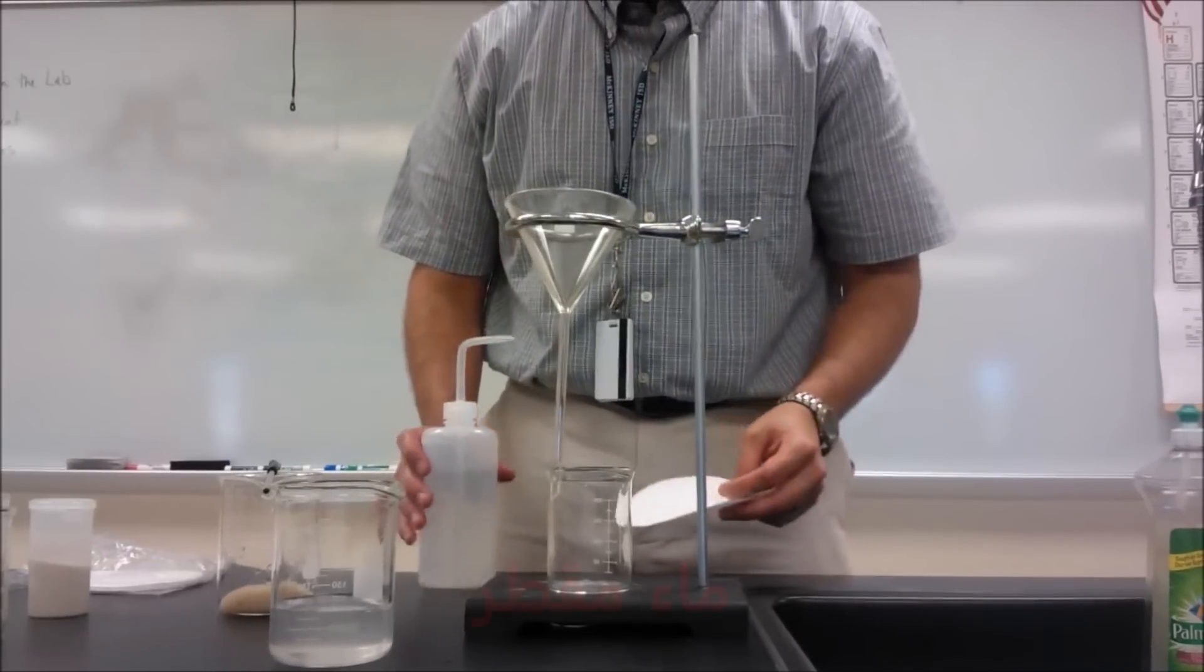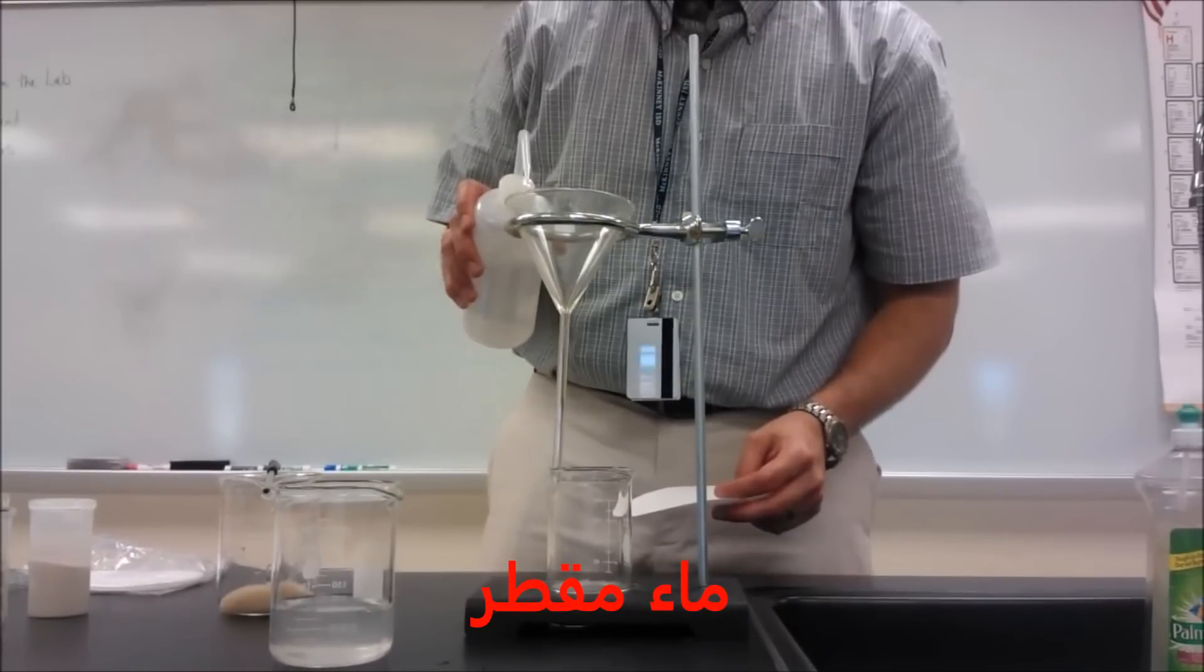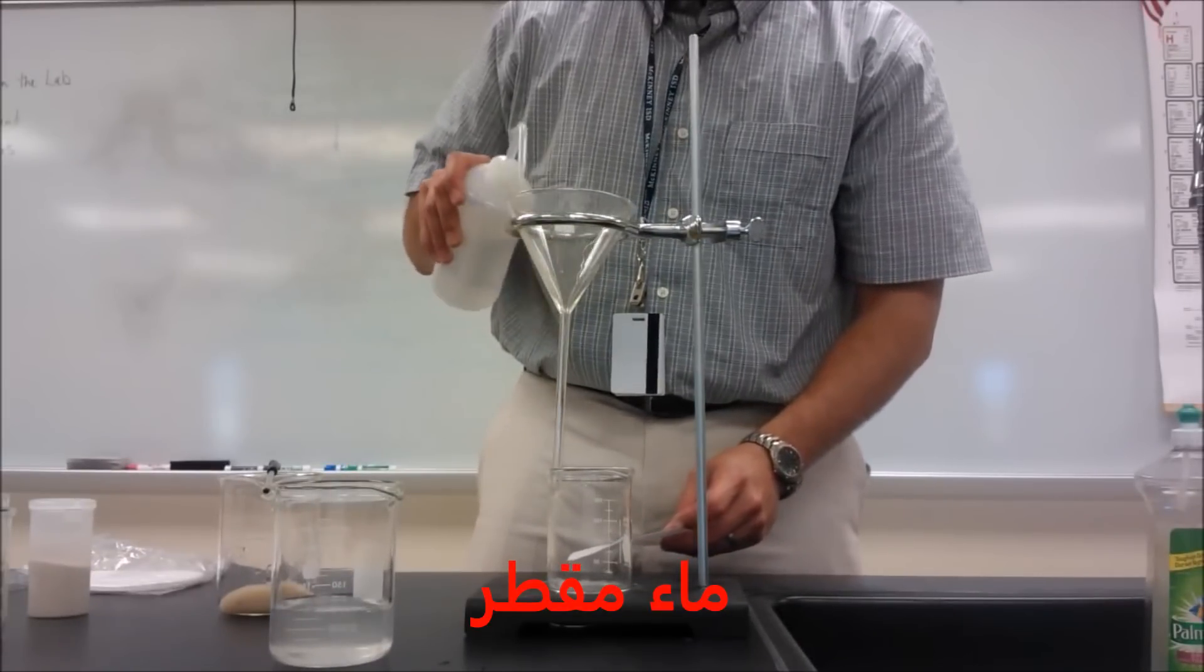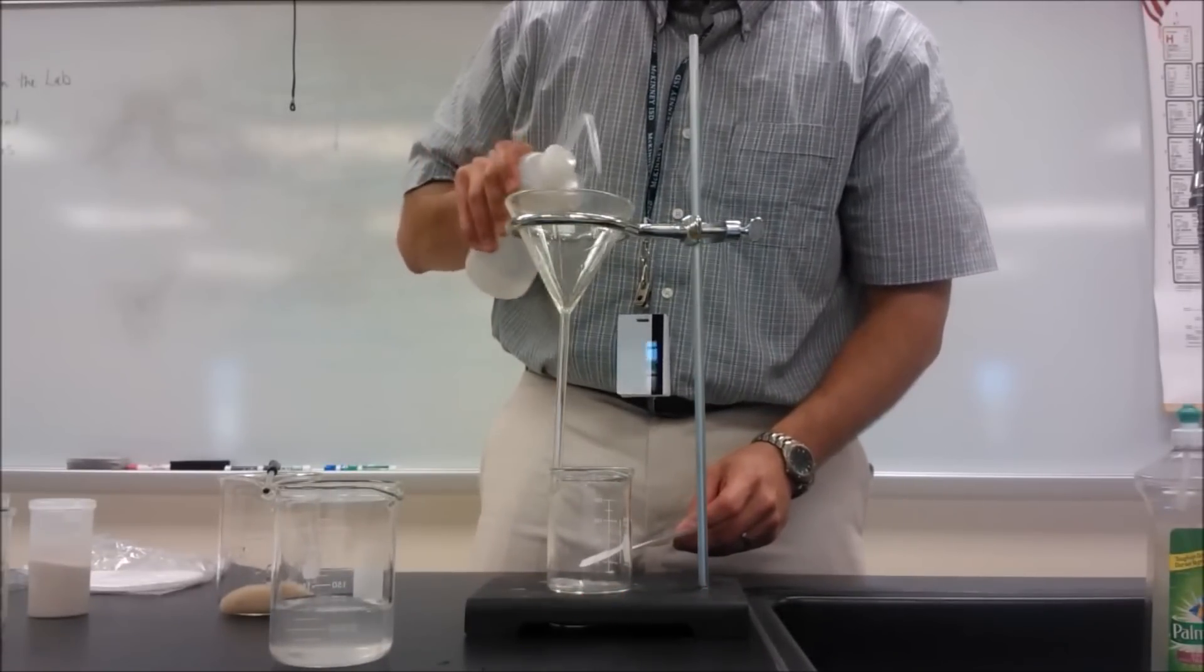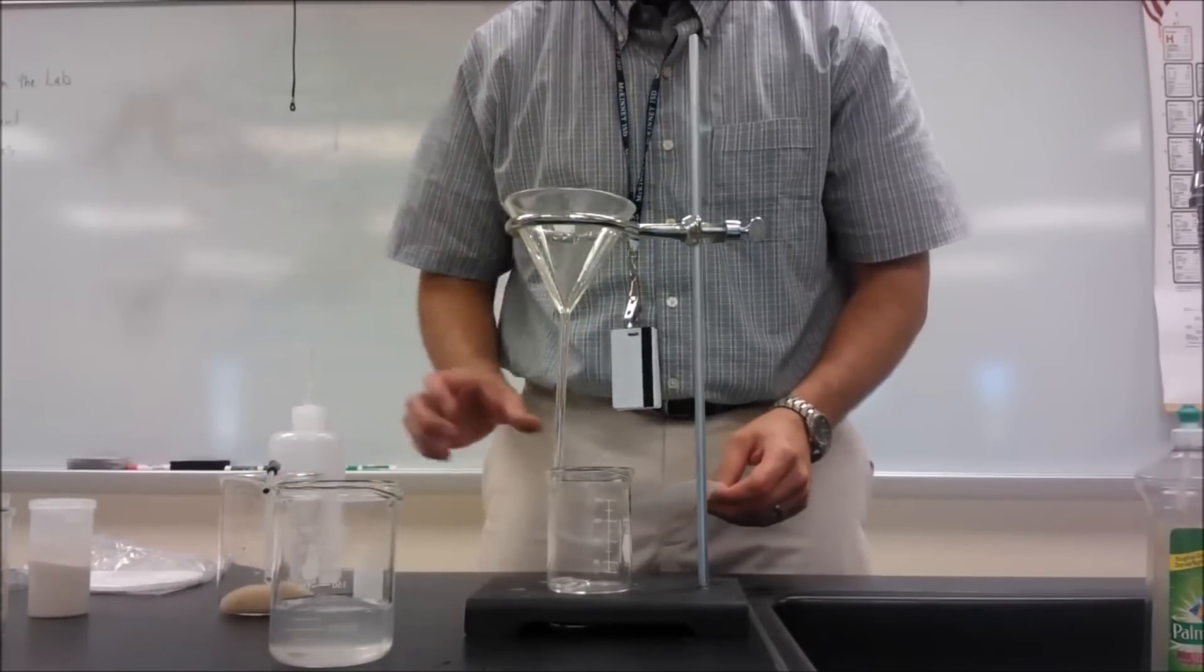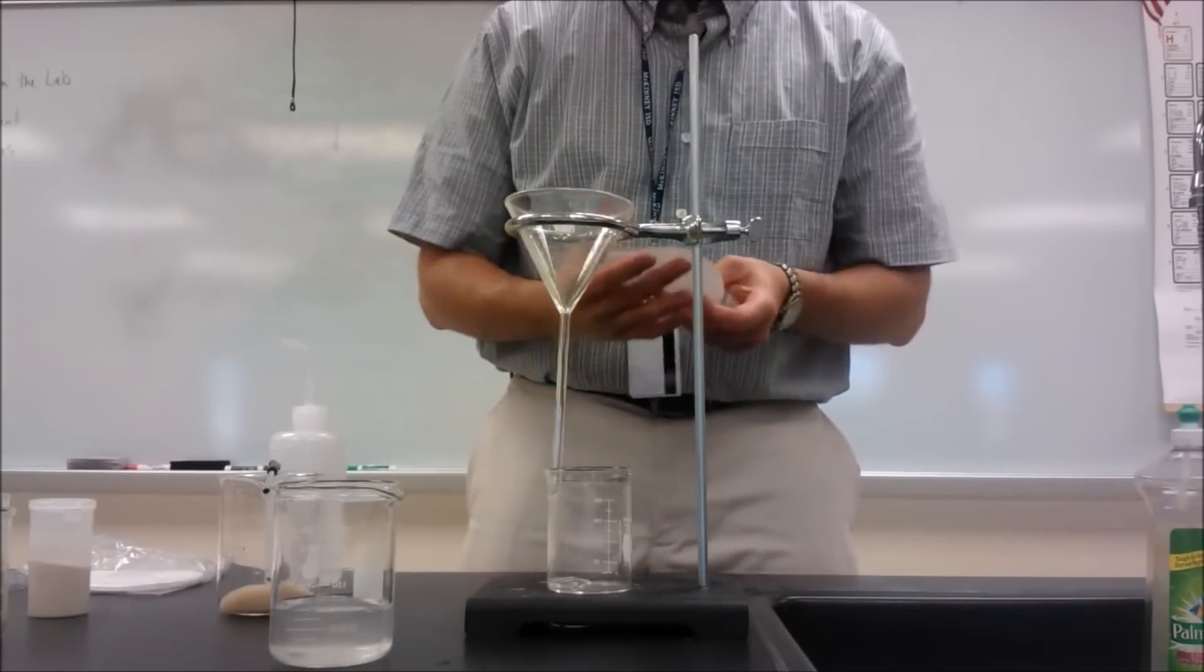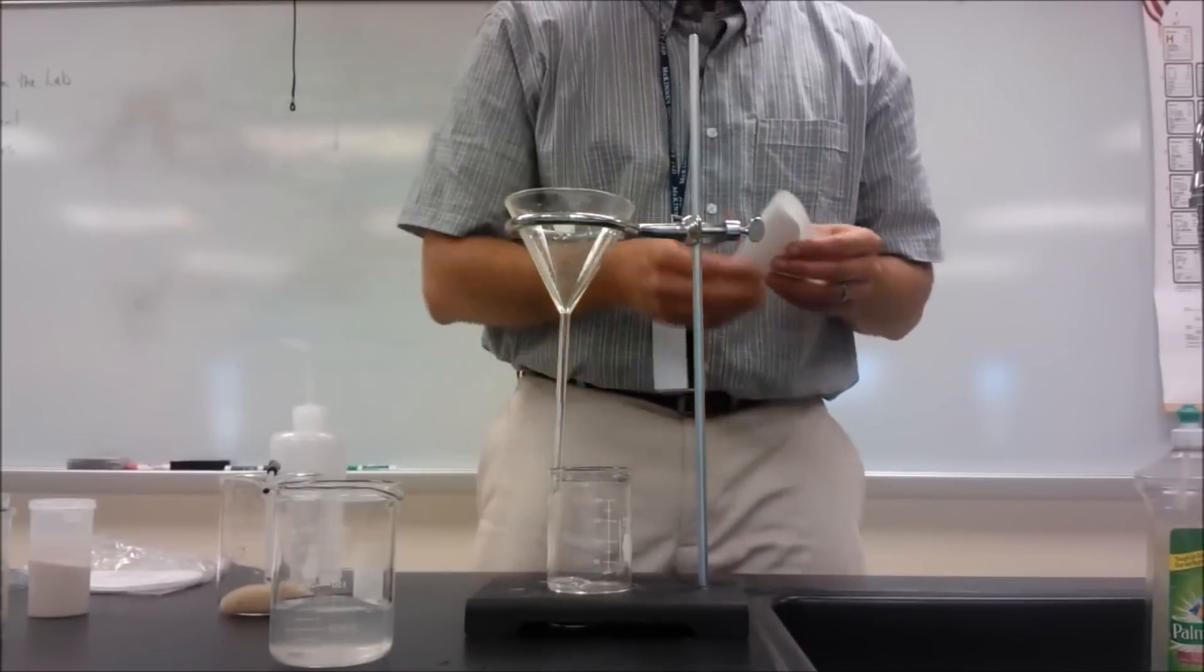I'm first going to squirt my funnel real quick so that the filter paper will stick a little better on there. Okay, you can see there was no splashing. In this case it's water on water so it doesn't matter. I'm not going to have to dump this out.